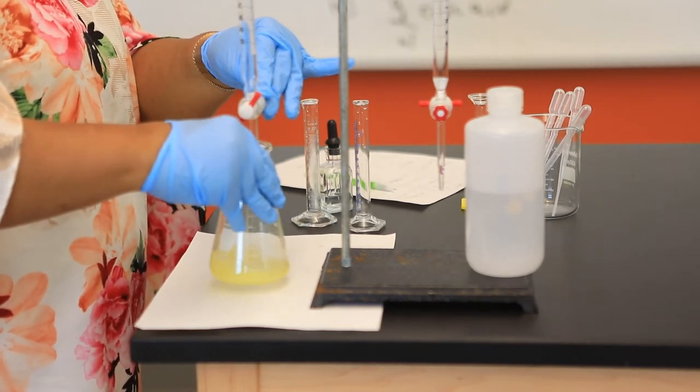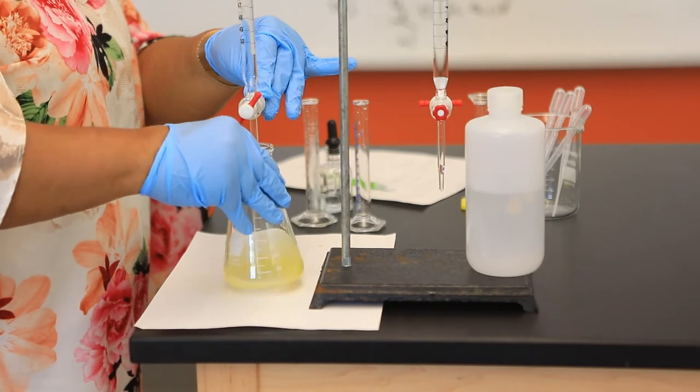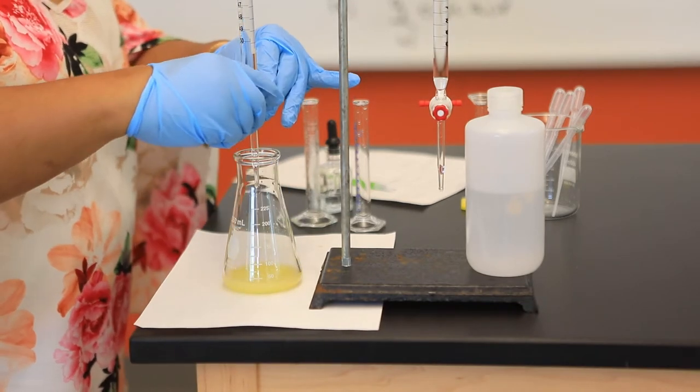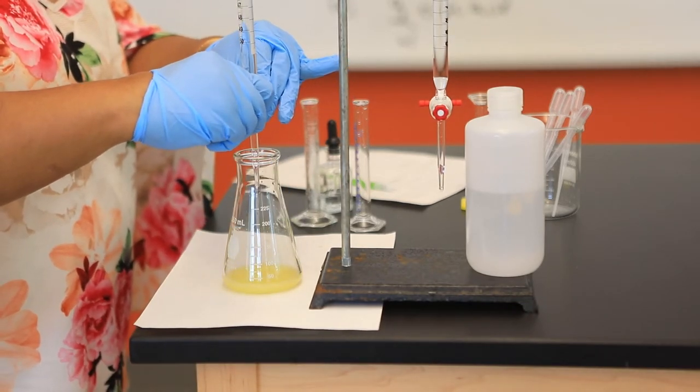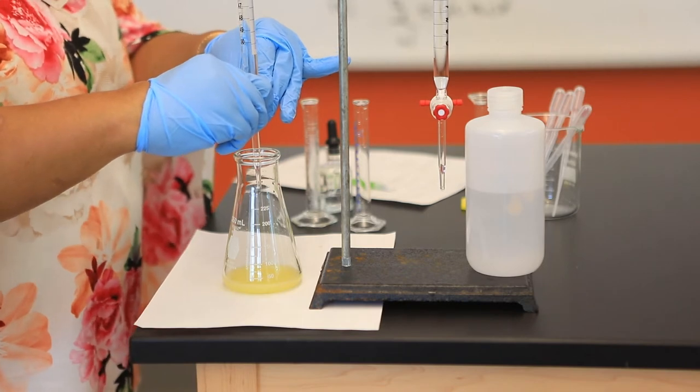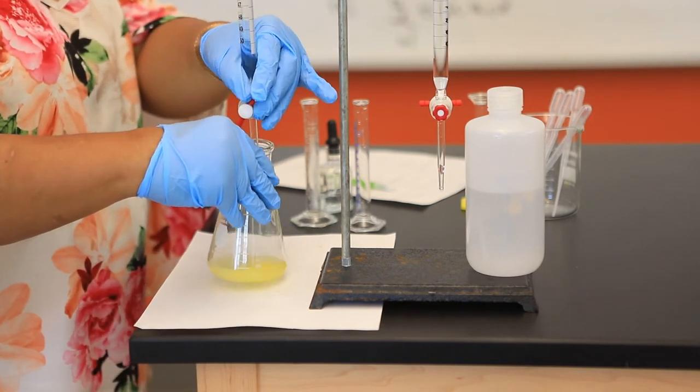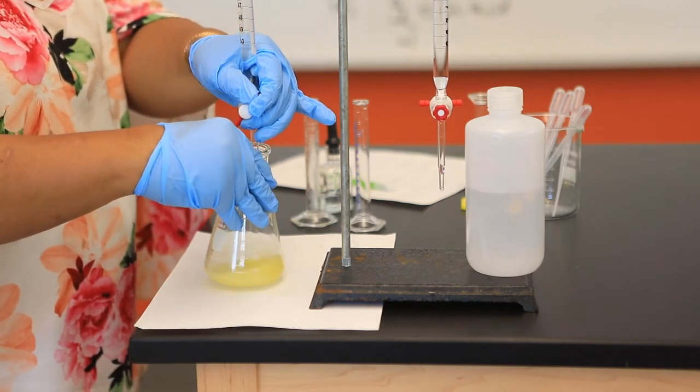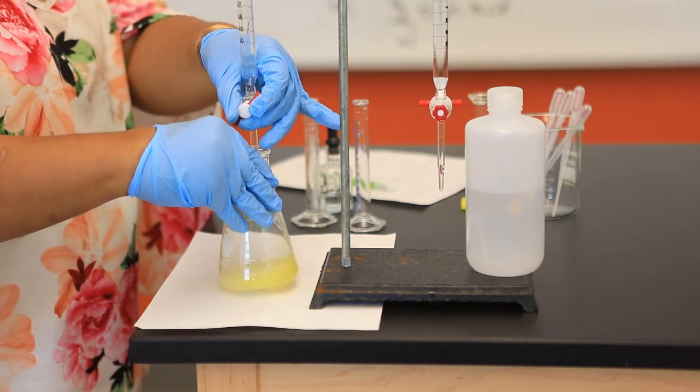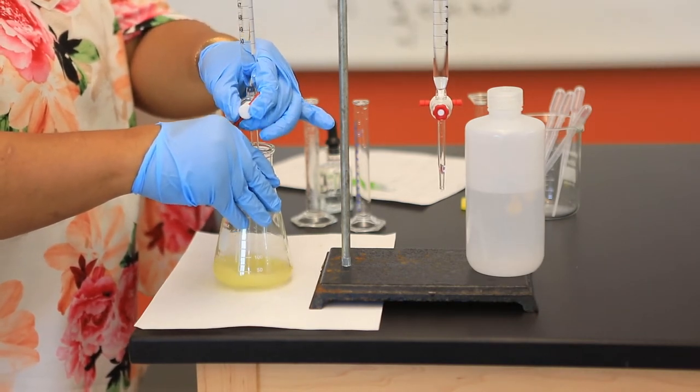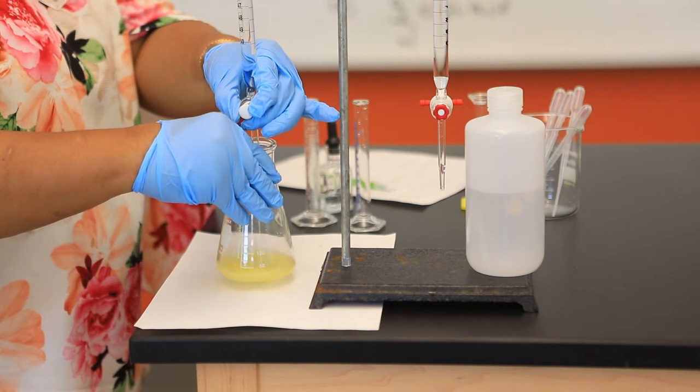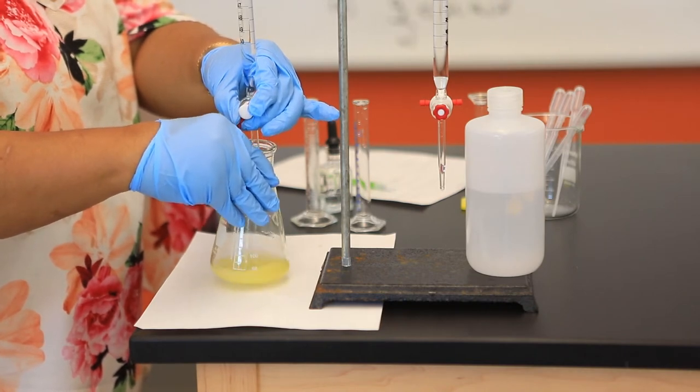Care, as always, must be taken. I'm going to be looking at the first sign in which the solution changes color. I'm only using 10 mLs, that was my original volume of my fruit juice. So I'm not expecting to add too much sodium hydroxide.